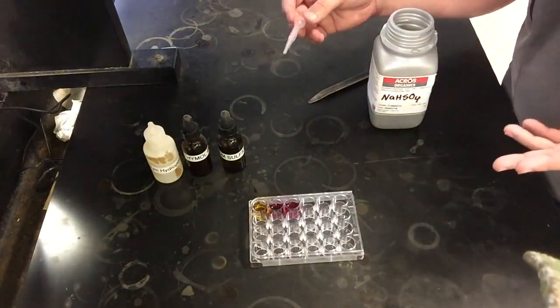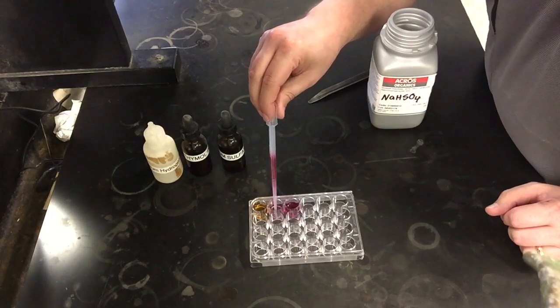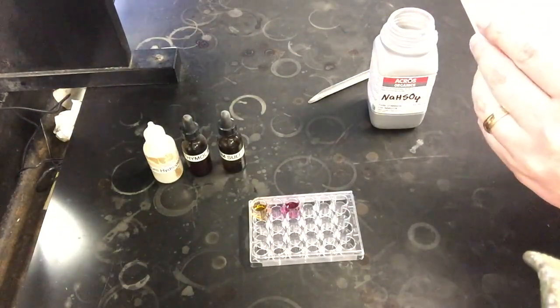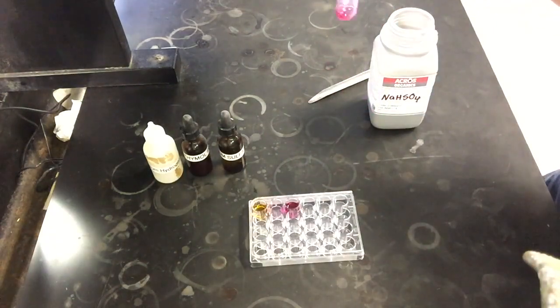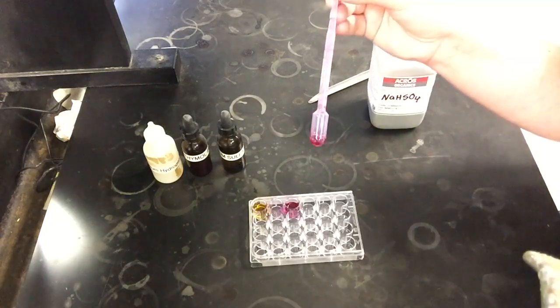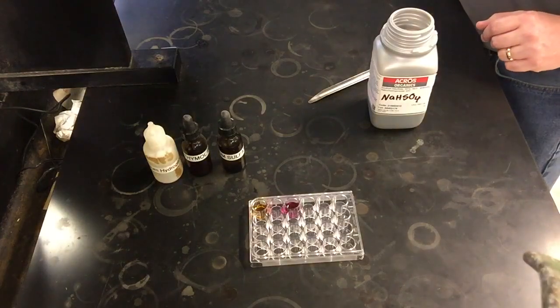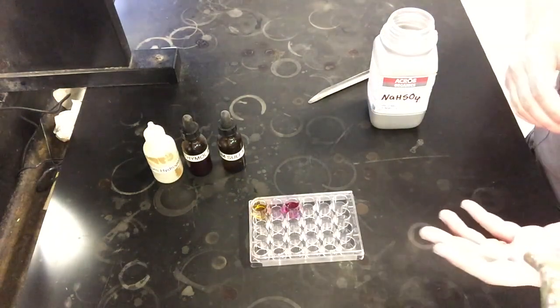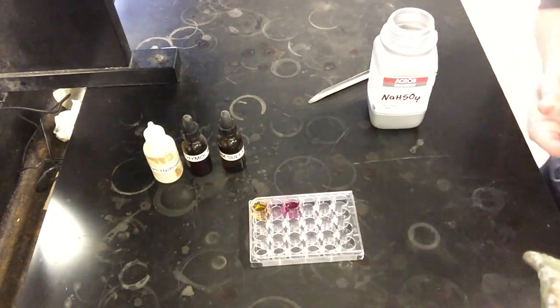And the last thing we want to take a look at is what happens with temperature. So this middle one that I haven't added anything to, I'm going to pull this up into a pipette and let this drain down to the bulb if I can here. There we go. And so now I have this liquid down here in the bulb. And what I want to see is what's going to happen to this as I heat or cool this down. So I'm going to stick this in a hot water bath for a couple minutes. And then I'm going to bring it back over here to show visually what it looks like after the hot water bath. And then I'll do the same for the cold water bath.